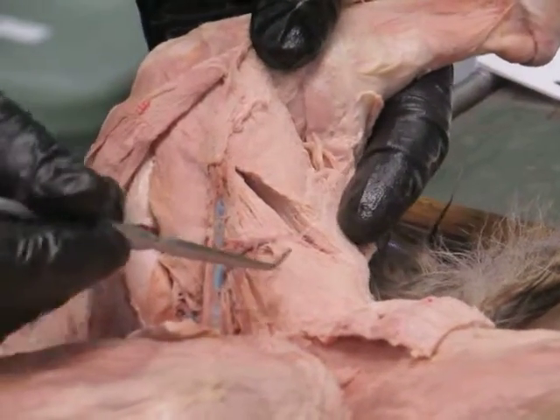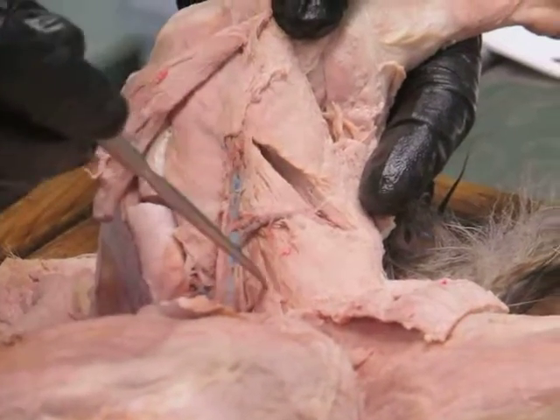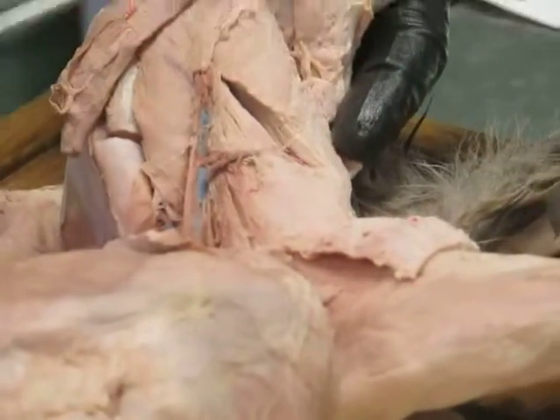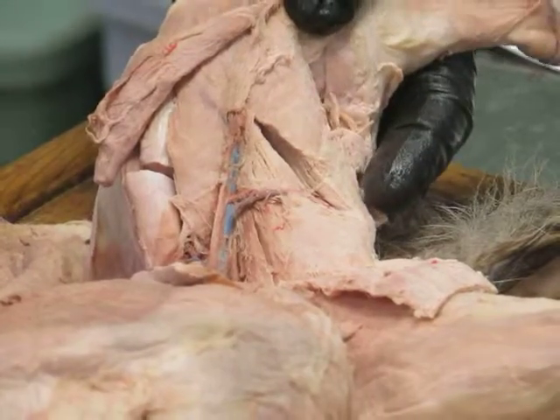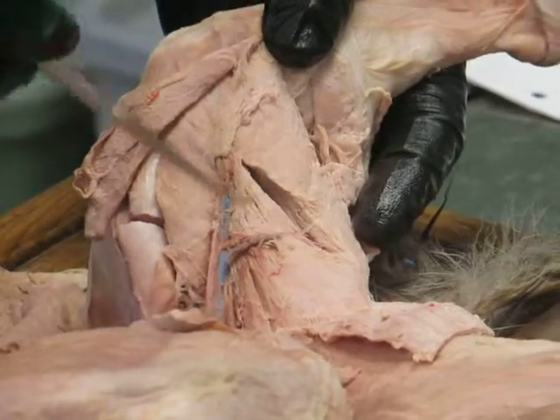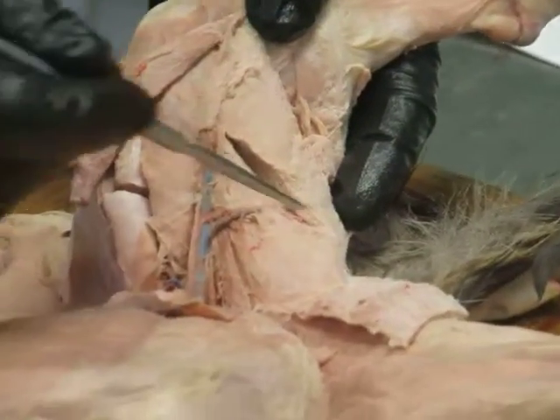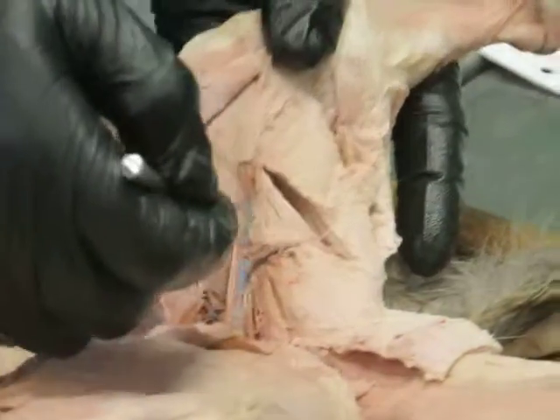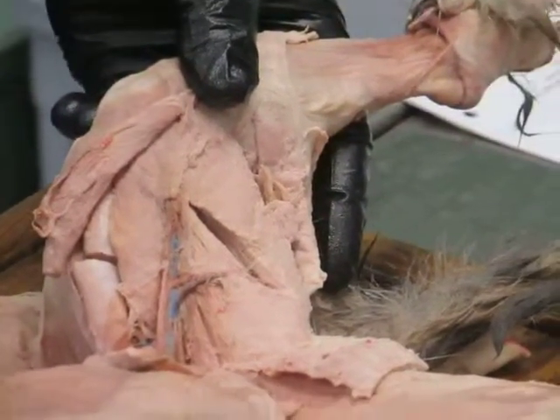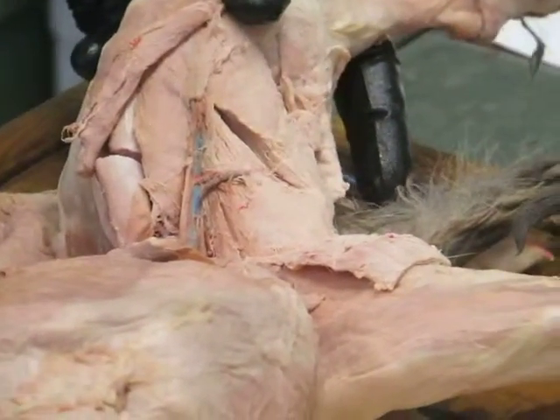Okay, and basically in here, there's this large muscle and then this small one that are the adductor muscles. And this is the adductor magnus et brevis, meaning it corresponds to both of those muscles in humans, the magnus and the brevis. Okay, and then this is adductor longus. And these muscles are arising basically from various parts of the pelvis, inserting into the back of the femur. Do you remember the linea aspera, that line on the back of the femur, on the caudal surface? That's where they attach or insert. And what do you think the action of the adductor muscles is?